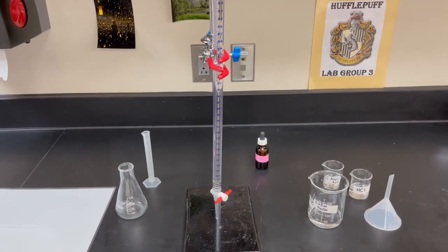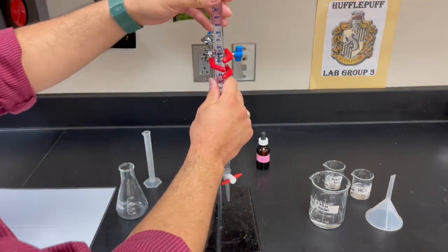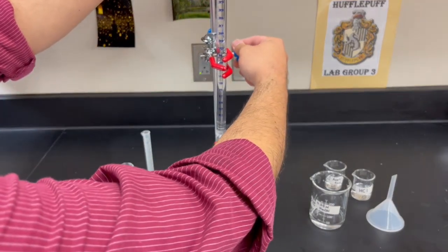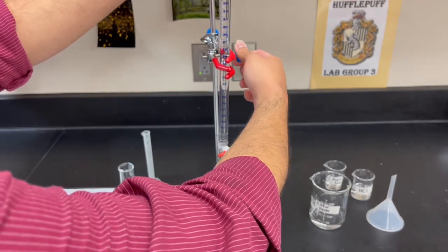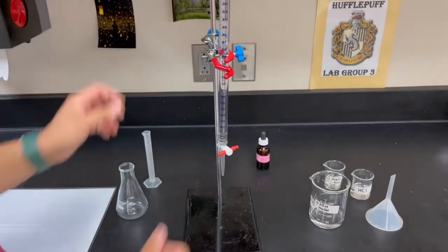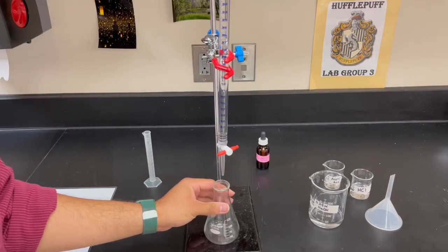Now, I'm going to position my burette above this platform here. Making sure my Erlenmeyer flask fits beneath. Perfect.